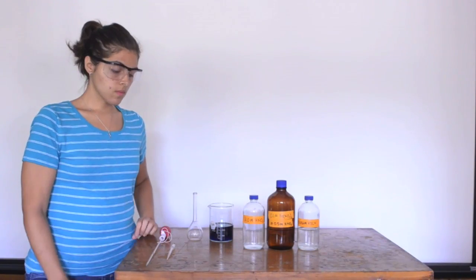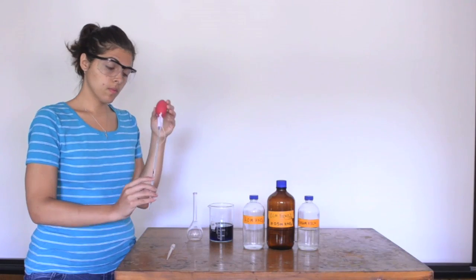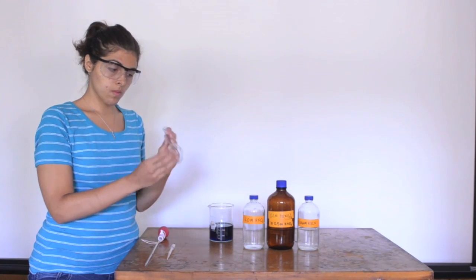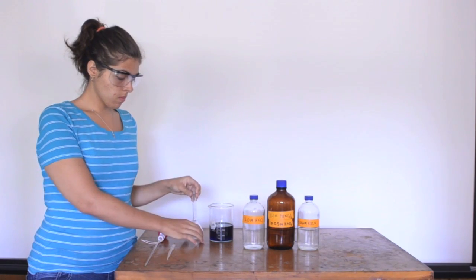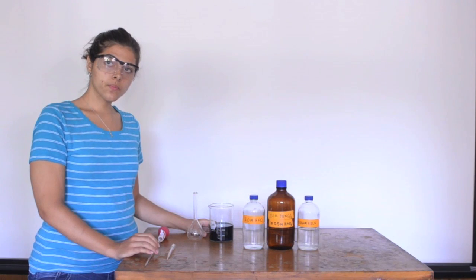Second, note that you'll be using a 1 milliliter volumetric pipette. We've previously discussed how to use this device. In addition, you'll be using a 100 milliliter volumetric flask that is similar to the pipette in that it measures a fixed volume of solution. The flask also contains a graduation mark to denote the fill line. So if you fill the flask with a solution to the graduation mark, you get exactly 100 milliliters.